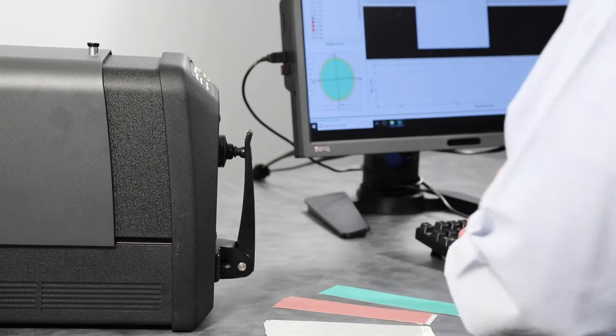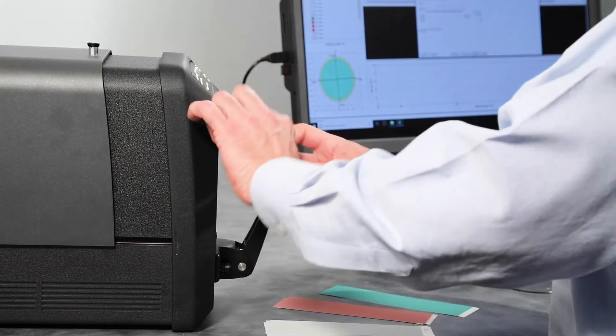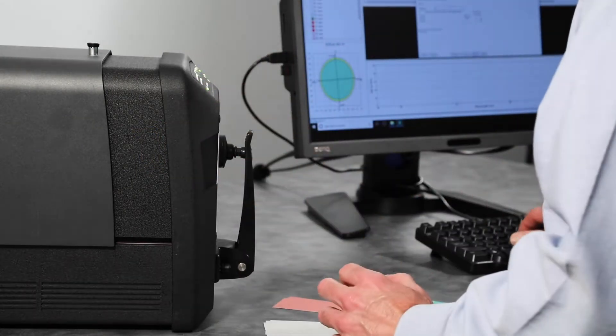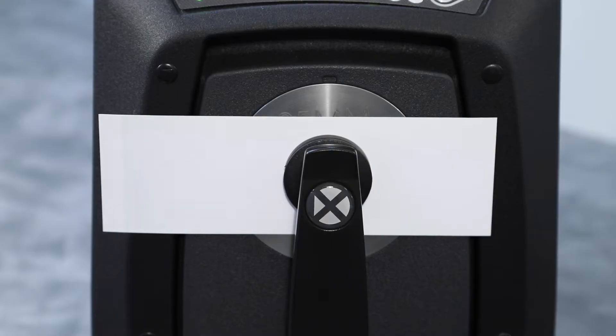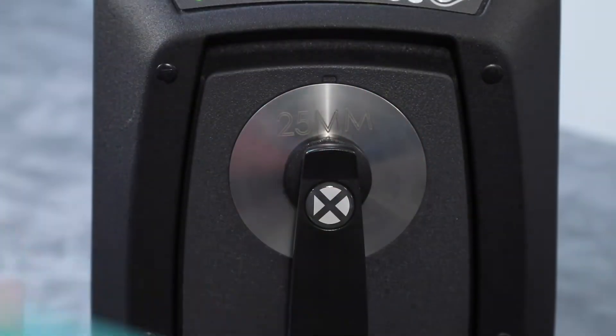Your instrument requires very little maintenance to achieve years of reliable operation. However, to protect your investment and maintain accuracy, a few simple cleaning procedures should be performed from time to time.